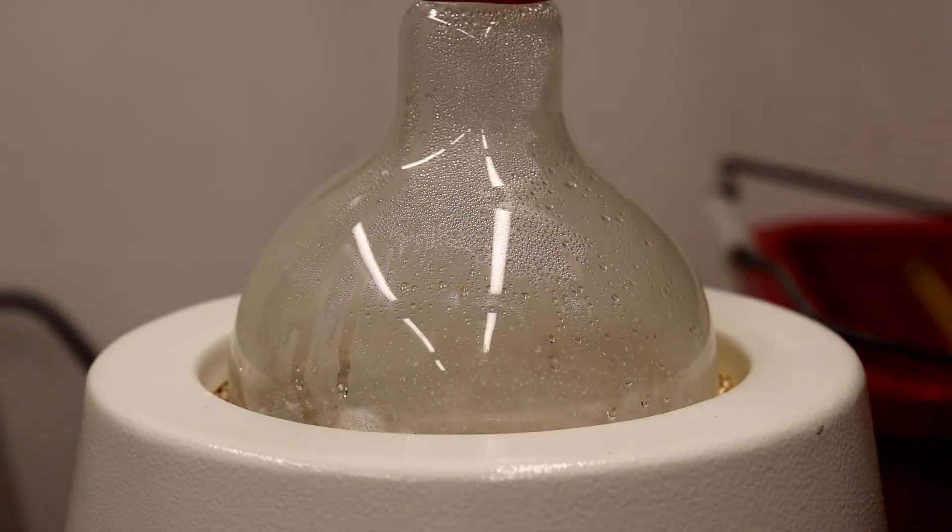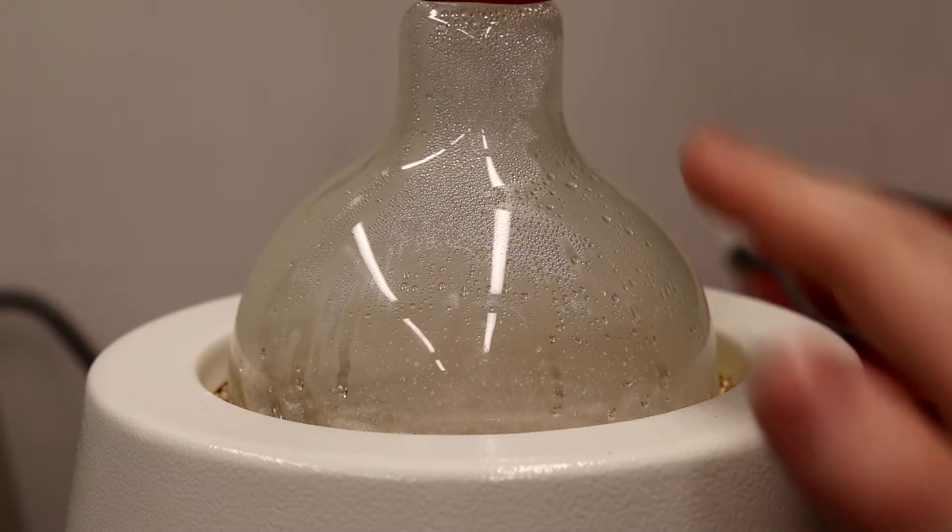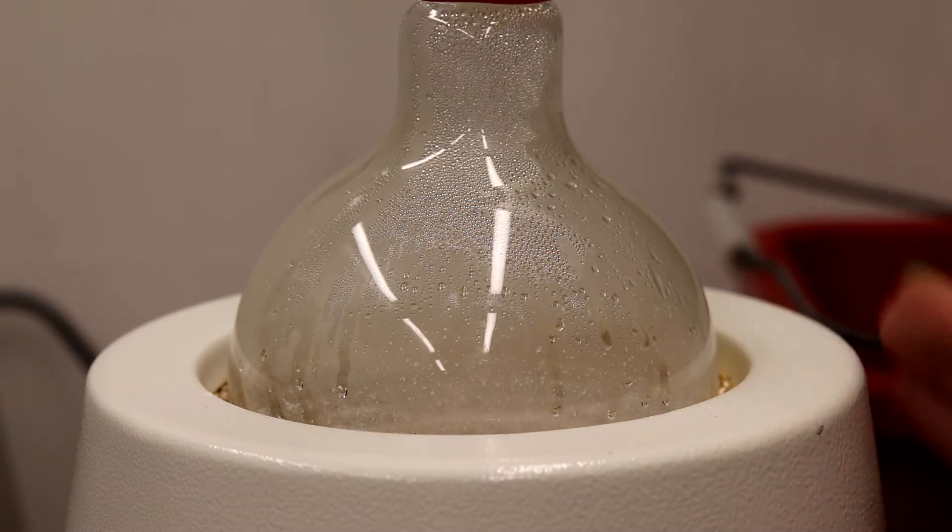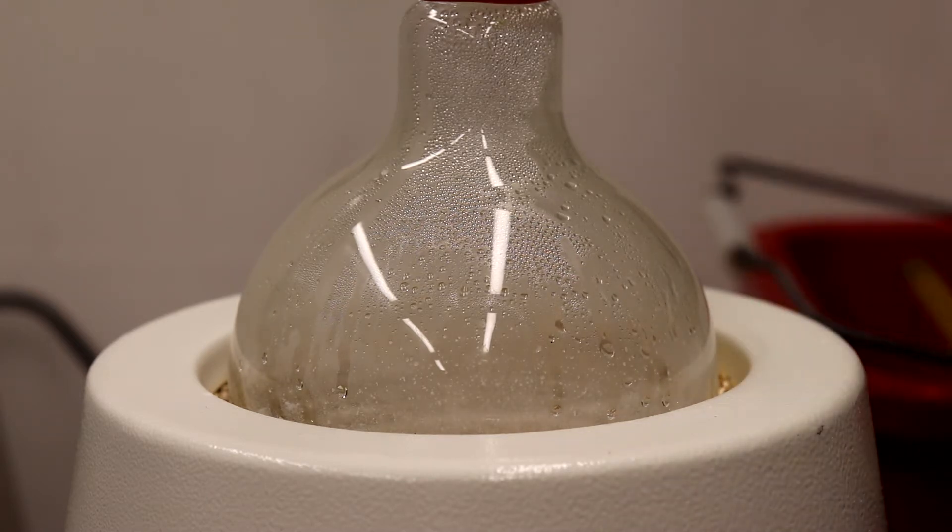So the solid is pretty much completely melted in the flask, and you can see the droplets of aniline forming on the walls, and that's going to start coming over into our receiver shortly.